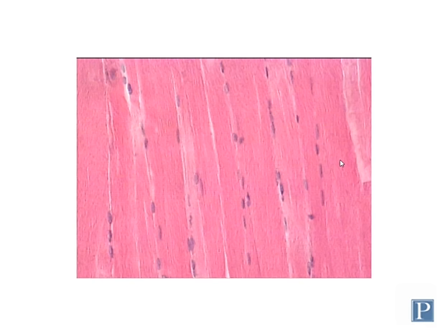You also need to be able to identify it in longitudinal section. When viewing skeletal muscle in longitudinal section under appropriate light conditions, you can see how it gets the name striated, because you can see these striations, which are alternations of light and dark bands.